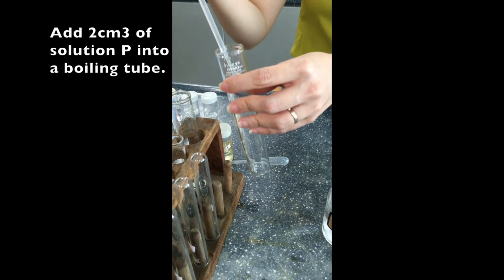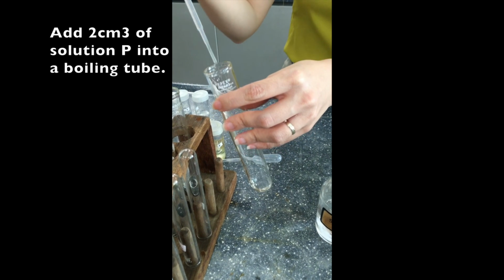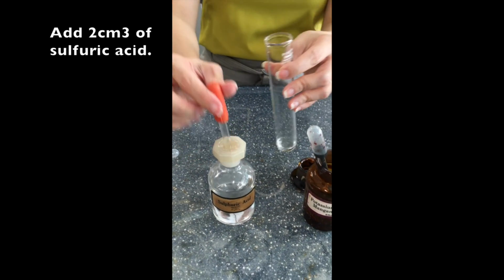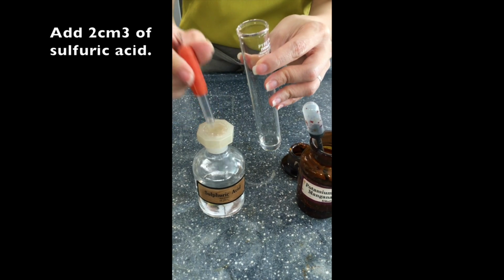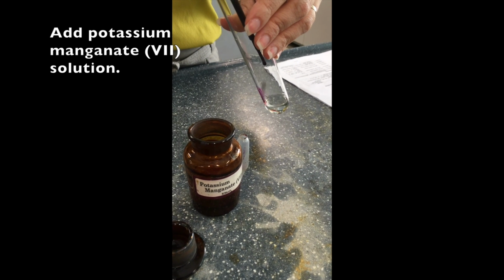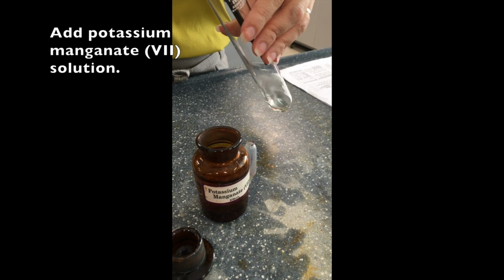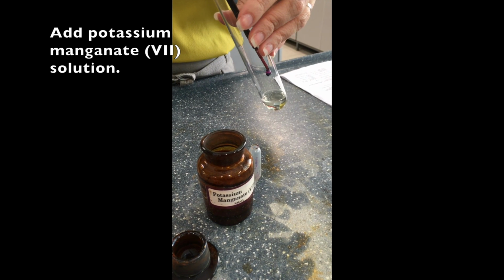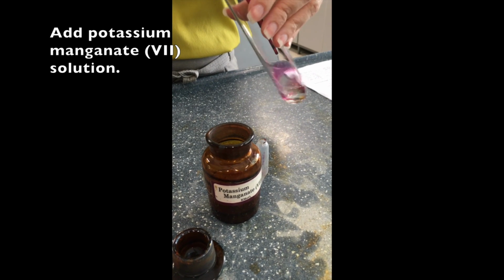Then next, we add 2 cubic centimeters of solution P into another clean boiling tube. We're just using 2 cubic centimeters of the diluted solution. Now we add 2 cubic centimeters of sulfuric acid. And here there is no visible change, no bubbles at all. So therefore we add potassium manganate. And you can see that the purple potassium manganate turns colorless each time it touches the solution P. So this must be a redox reaction.